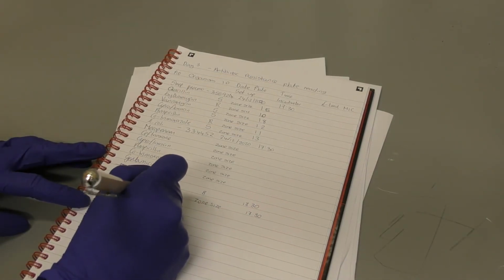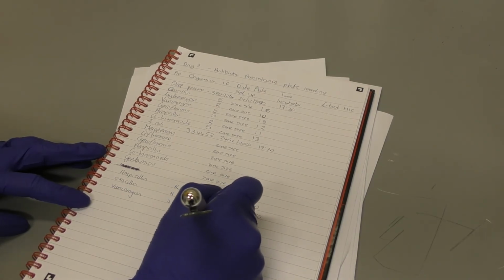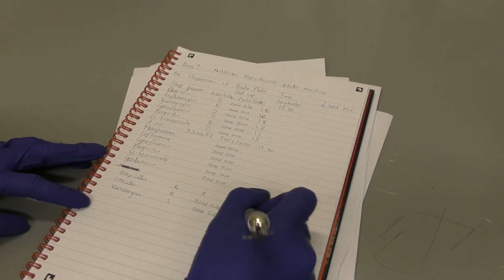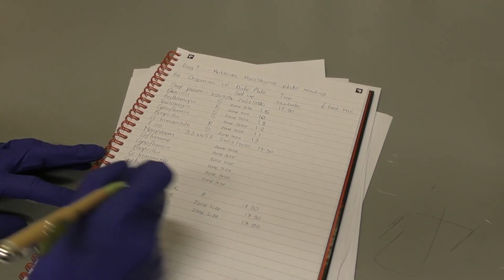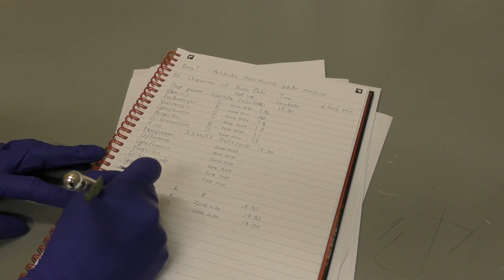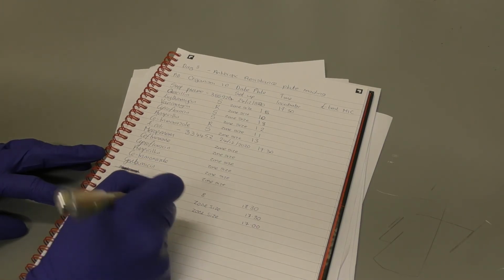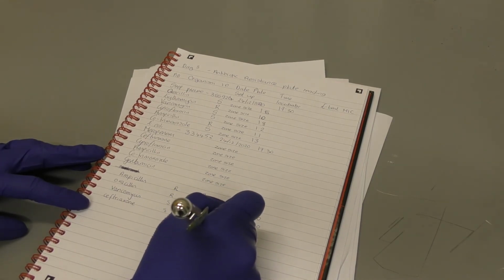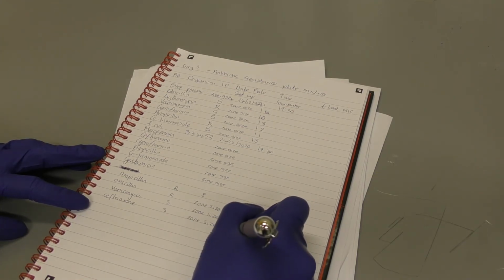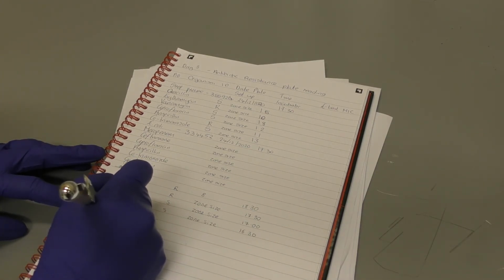It's crucial that when you're recording your sensitivity pattern, you record what your zone sizes are in your lab book. This needs to include what your plate IDs were, what your organism IDs were, what the zone sizes were, as well as whether they were resistant, intermediate, or sensitive, what your control sample zone sizes were, and also what next steps you take, i.e. are you going to set up a further test via an E-test for MICs?